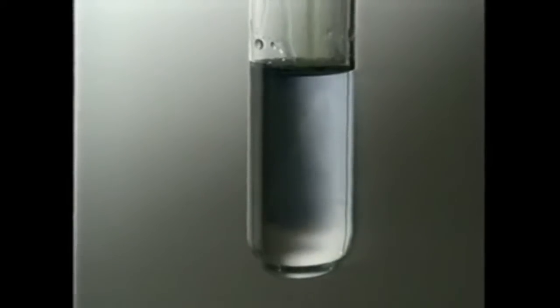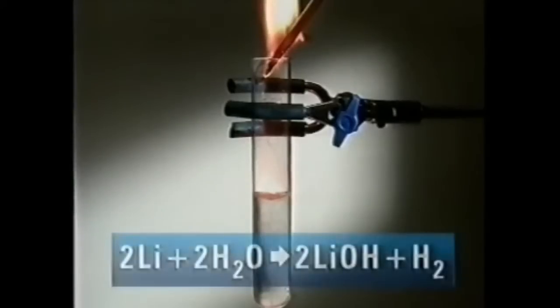Universal indicator shows that at the end of the reaction, the solution is alkaline. Lithium reacts with water to form lithium hydroxide and hydrogen.